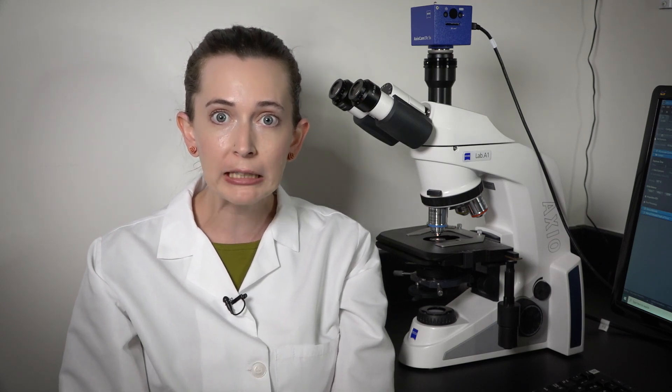Today we'll be learning a lab technique that will allow us to visualize meiosis happening in flower anthers. Yeah, we're gonna see it with our eyes! What?